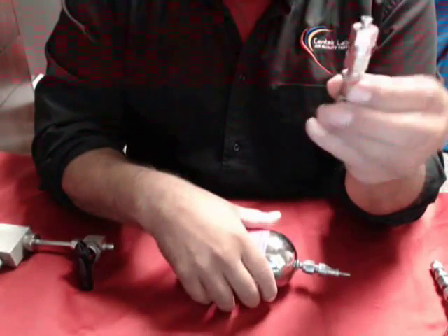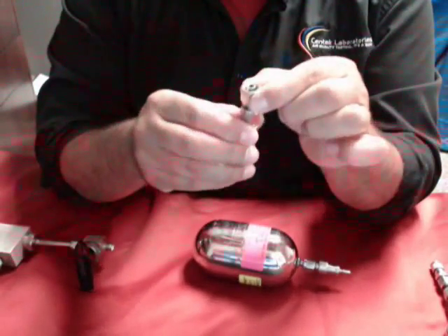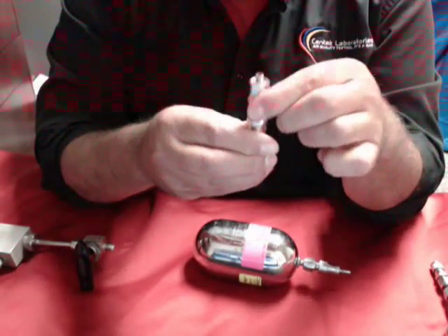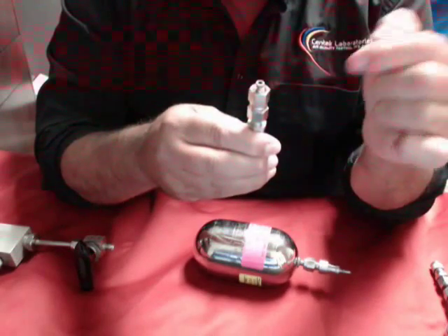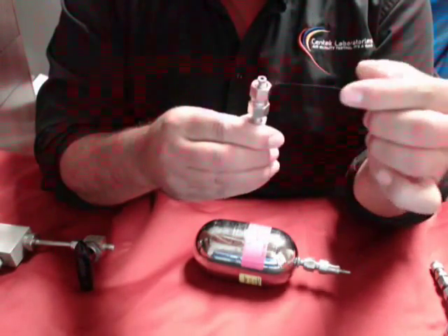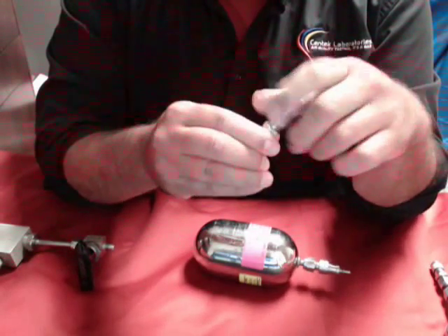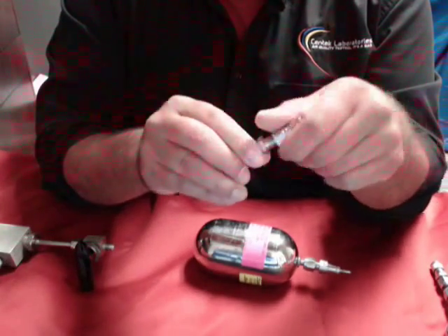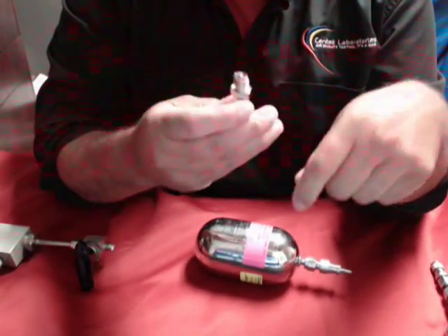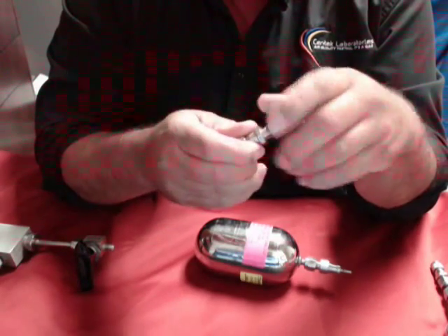Your quick grab has a female ending, which is used with a 9/16th nut — also a quarter-inch inside diameter. And if you do have the other type of ending, you can remove the end and put it onto the larger fitting to your female ending.